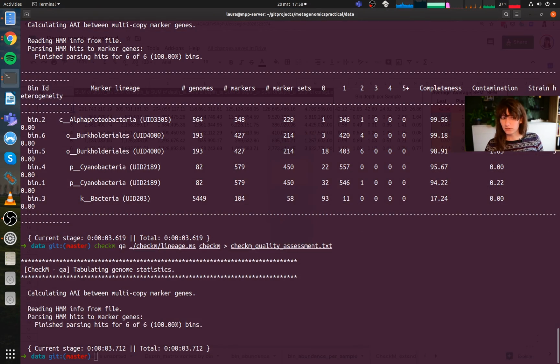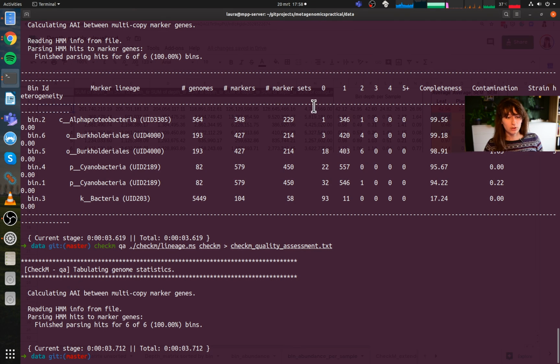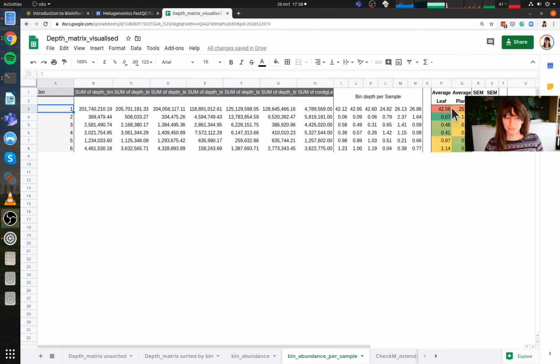I'm confused with all the windows. There we are. Bin number one is the one over here. So it's the super abundant bin, the cyanobacterium. So that's the one that we know is already present in the plant, right?